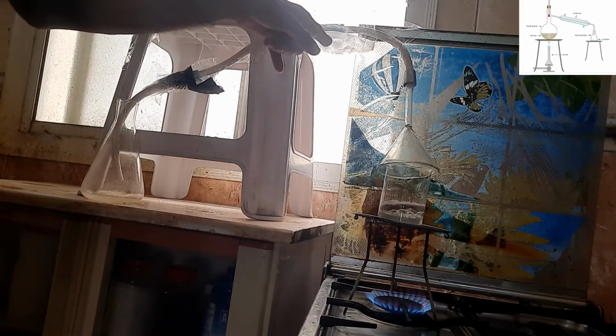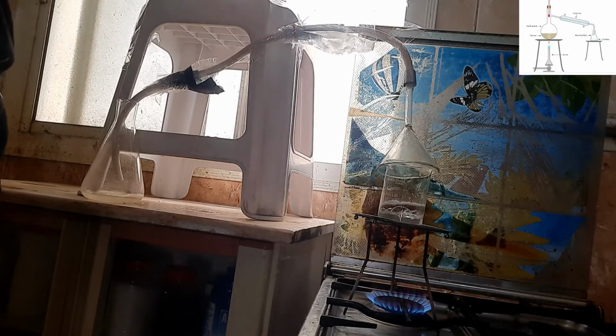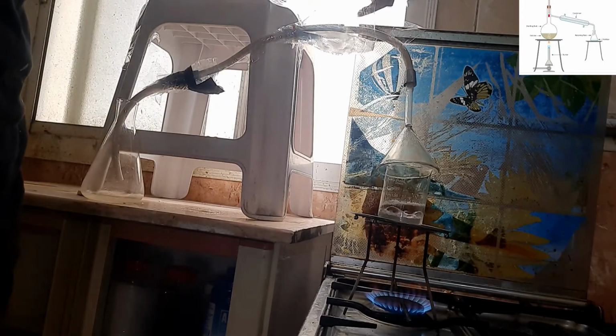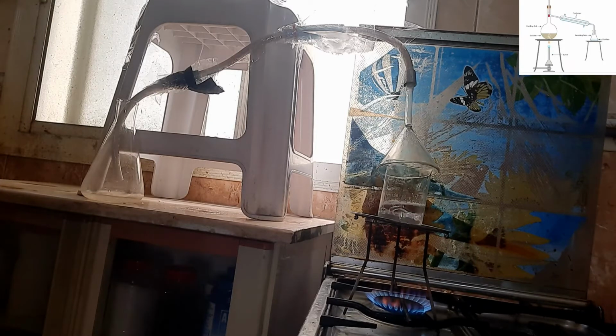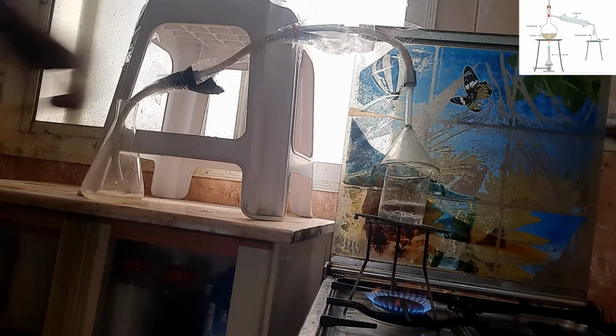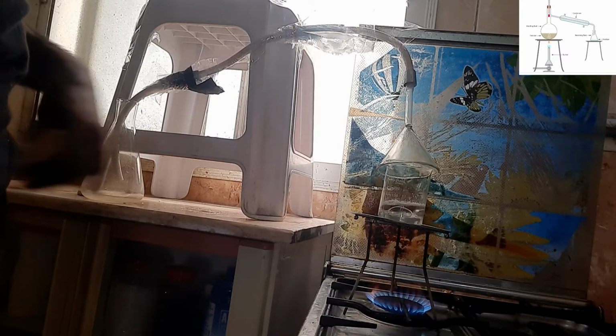Also the speed of melting of the ice is increasing, because continuously the hot vapors pass through this region, and because of the heat of that vapor the ice starts melting, and some of the water is also dropped down from there. This is because of the melting of ice. So the procedure is under process, and after some time we will have a result.